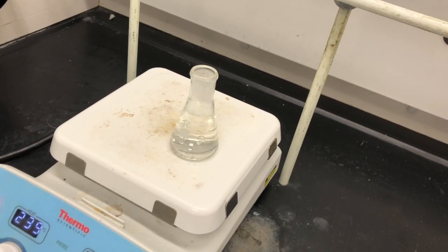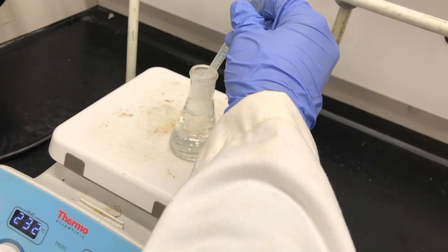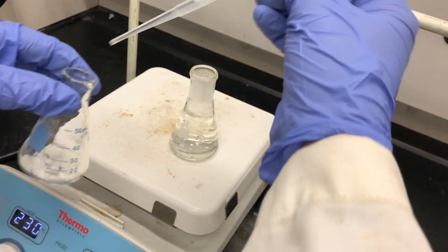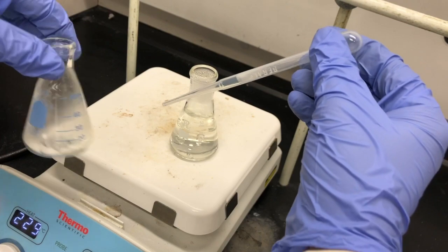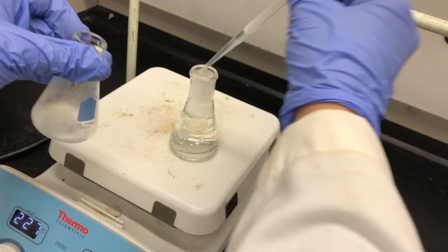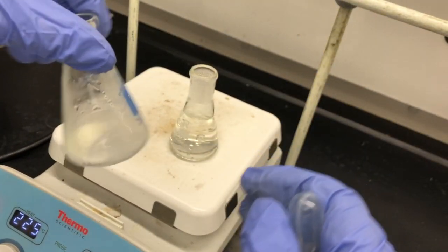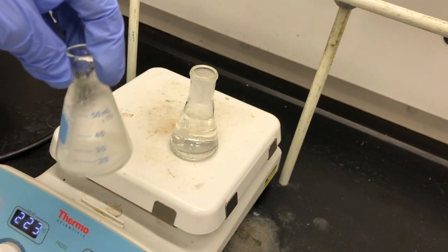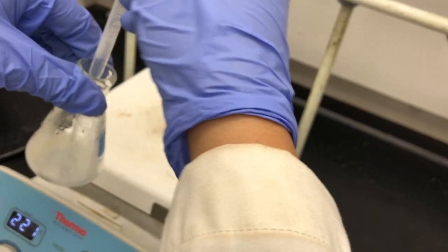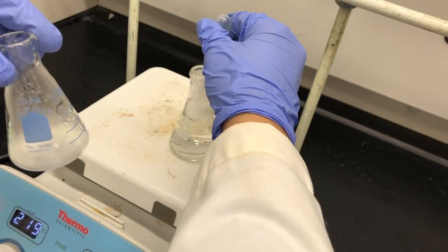So now that the water is right around 95 to 100 degrees Celsius, what we could do is start adding a small amount of hot water. We're going to use a plastic pipette. We're going to add a small amount of water. We're going to swirl it until it dissolves. I'm going to add some more. If you feel like the flask for the NBS is starting to cool down, you can actually place it on the hot plate slightly to keep it warm. Take a look. You still have some that is not completely dissolved.